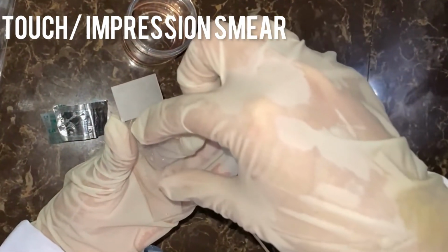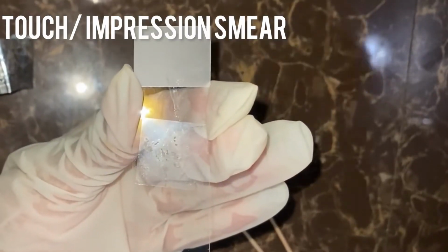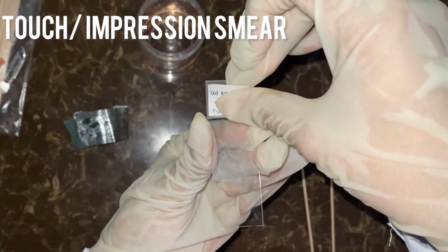Fourth, cover the smear with a cover slip. And fifth, label the slide.